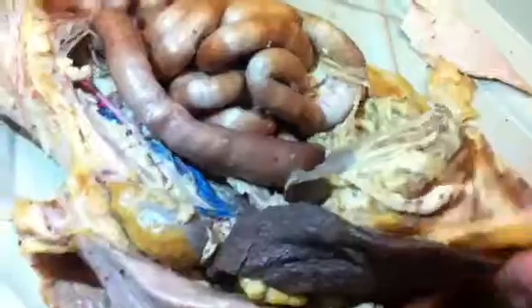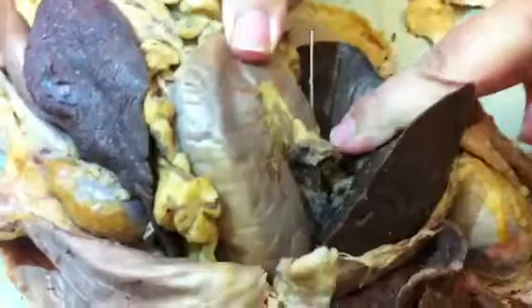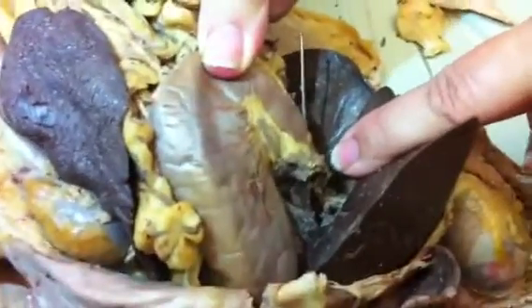She's got a very big one. You look at this. It attaches to the intestines at the duodenum. Okay, that's the big thing. Because at the duodenum, which is the beginning of the small intestines, it spills right about here, if we could. Okay. So if you looked at it this way, you could see it feeding in. I can put my finger there. You can see it. So that's where the pancreas will feed all the pancreatic juices into the intestines, right after the stomach.